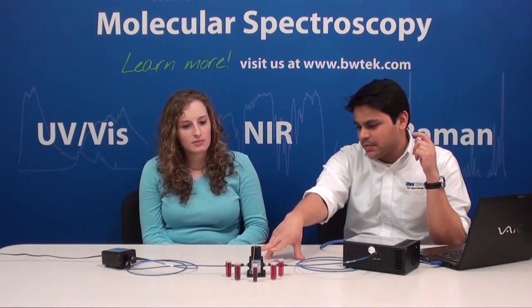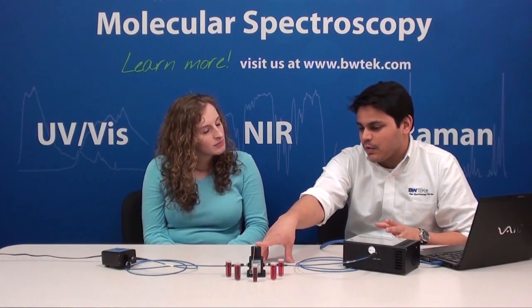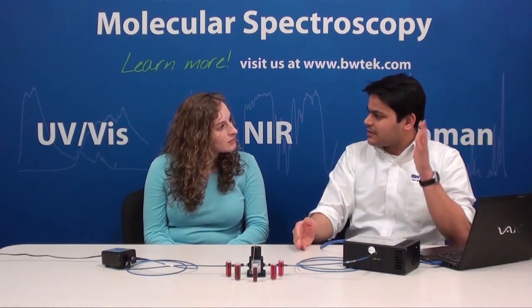So, that's exactly what we're going to be measuring today. We have a red dye, which we've diluted to five different concentrations, and we're going to be measuring the absorbance to find out a little bit more about the concentrations. And can you describe the setup that we have here a little more?